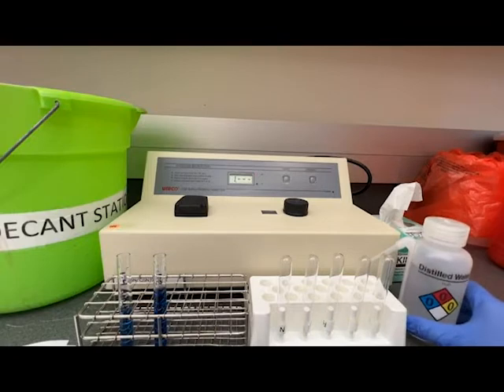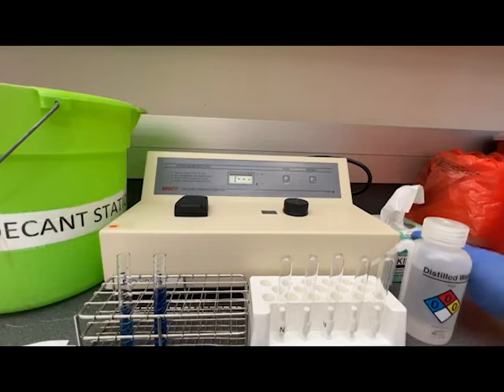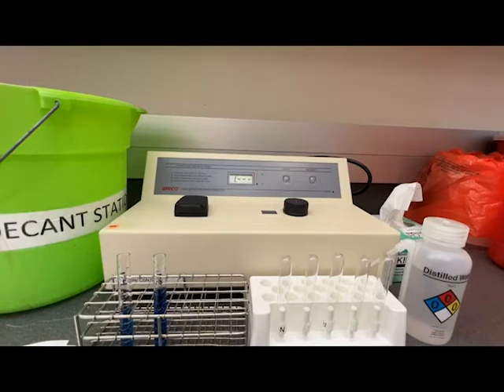I have distilled water in order to rinse the cuvettes between samples or when I am finished, as well as Kim wipes to wipe the outside of the cuvette and a decant bucket to discard any solutions.